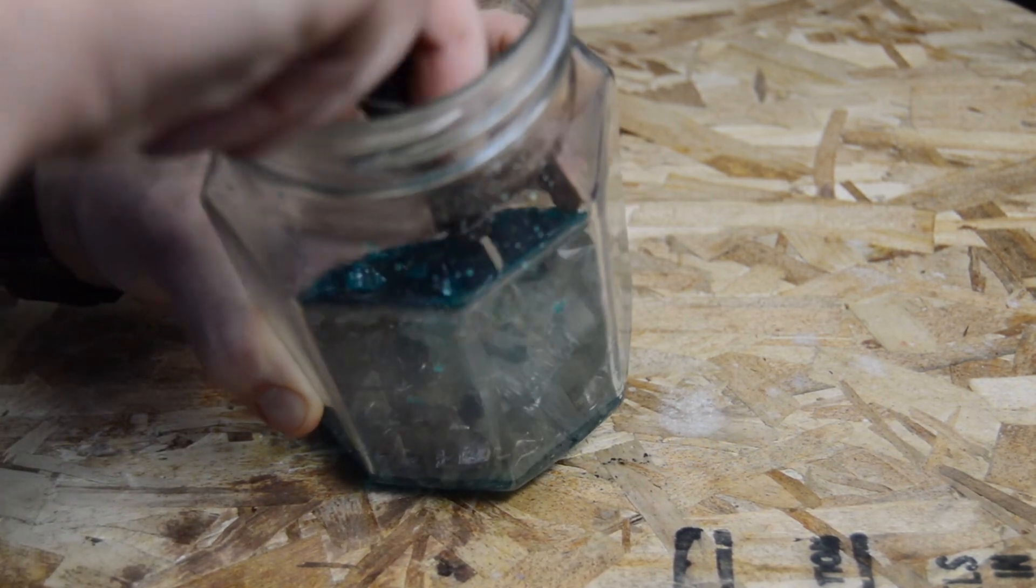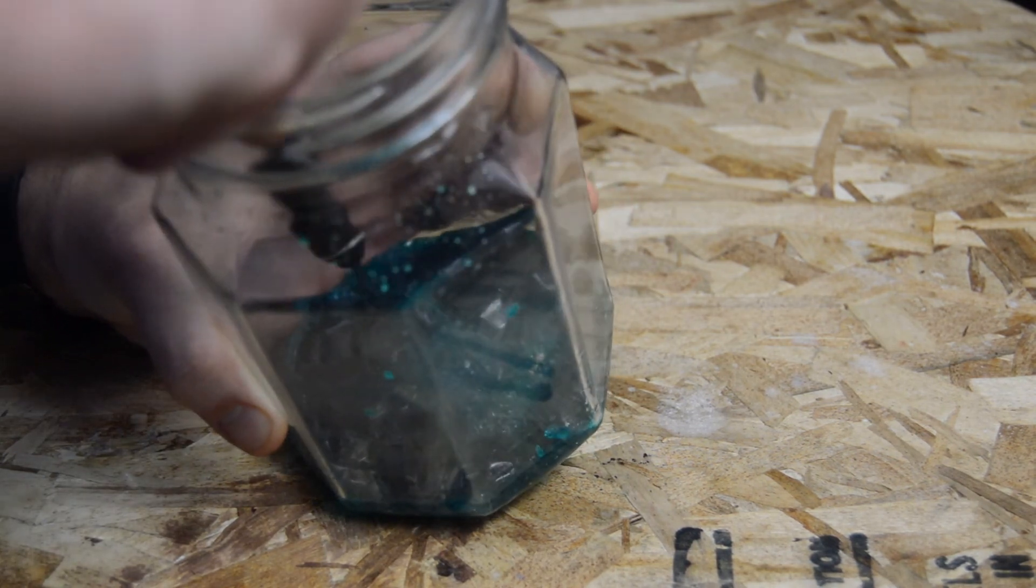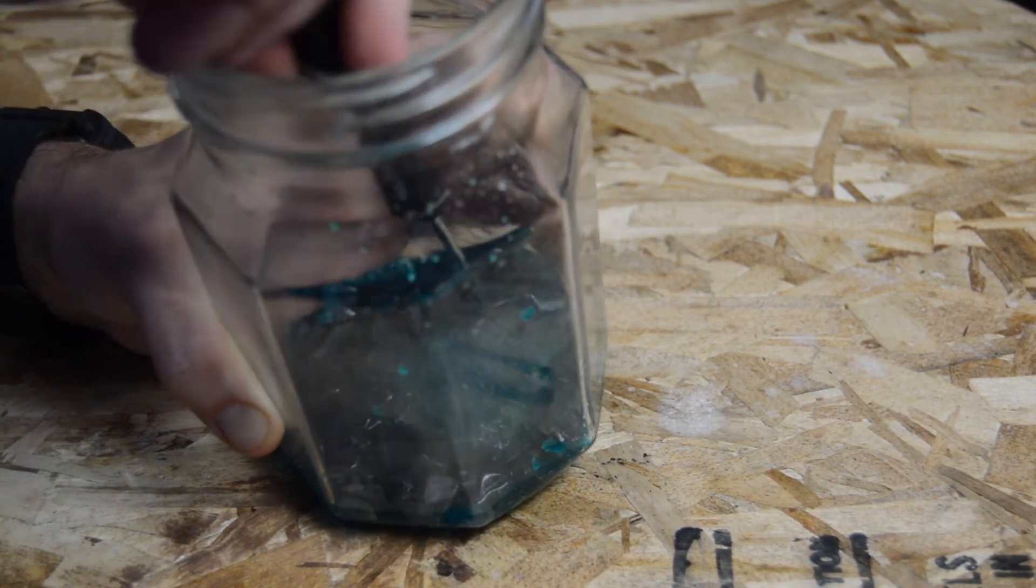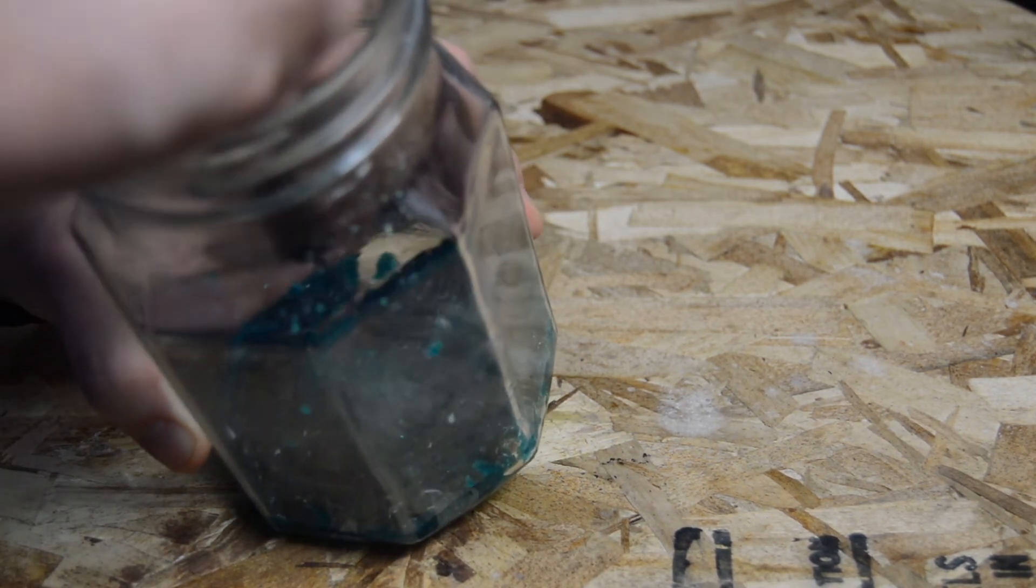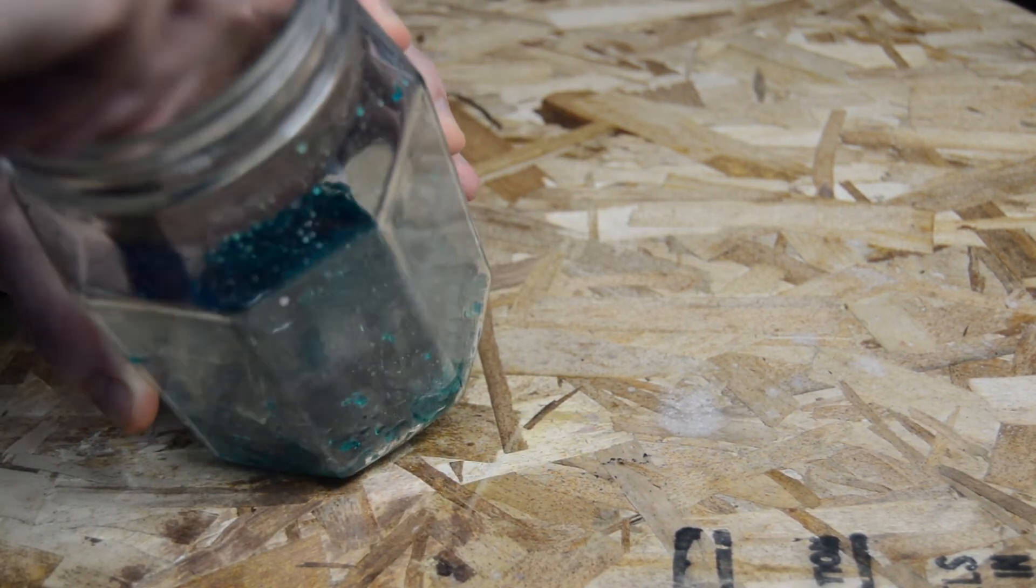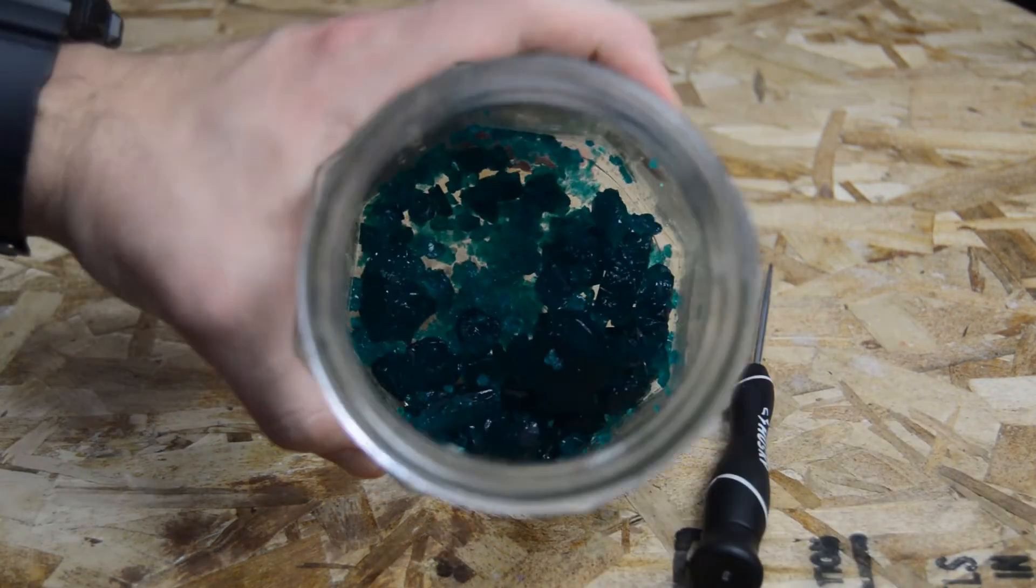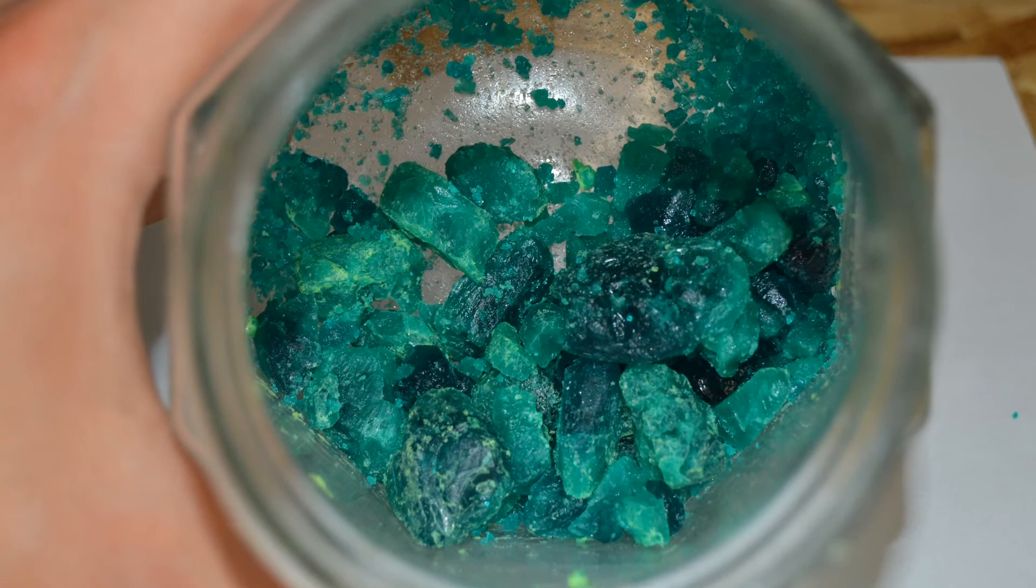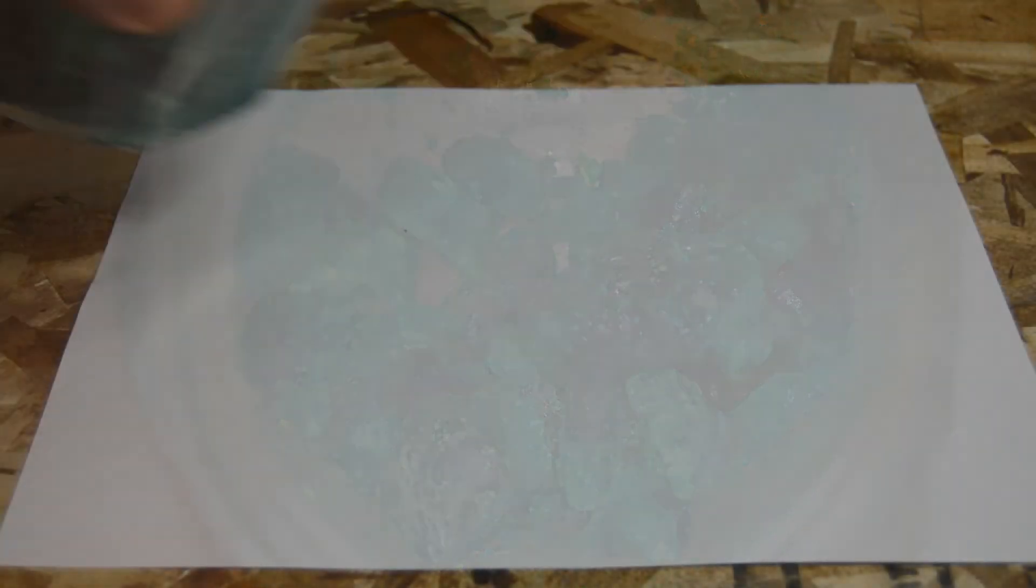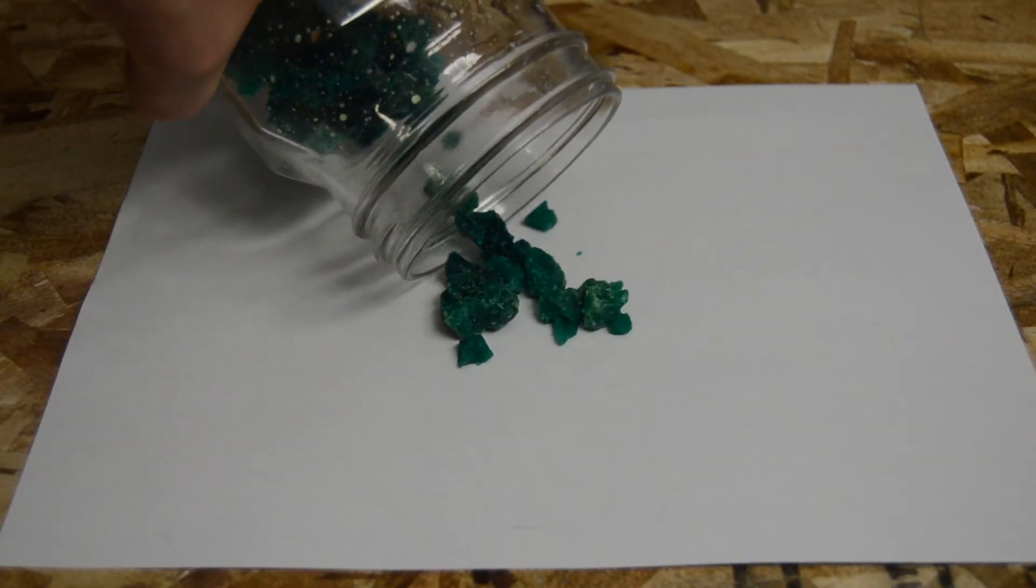Now what's the purpose of this experiment since you can just buy nickel sulfate crystals? Well it turns out you can perform this experiment for about 15-40% of what it would cost for the same amount of nickel sulfate, of course depending on how much you purchase. Obviously when a larger amount is purchased, the price goes down. And unless you're in a laboratory environment, then the purity of these homemade nickel sulfate crystals is high enough for most projects.